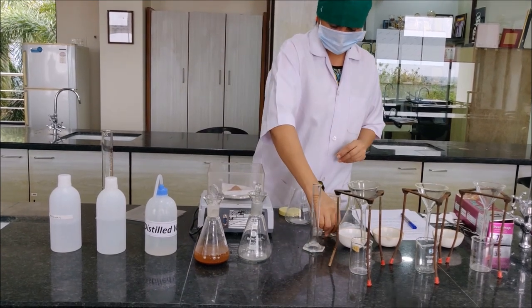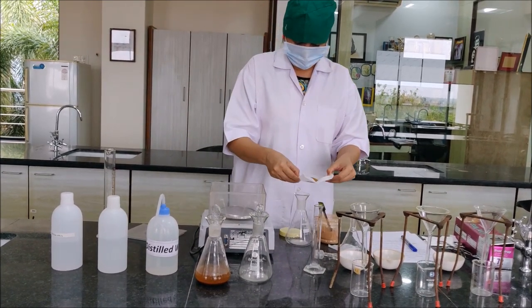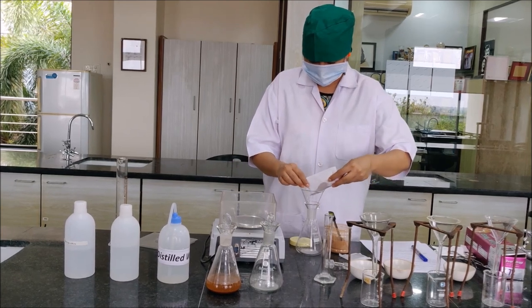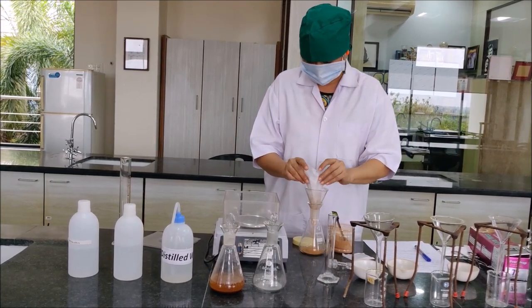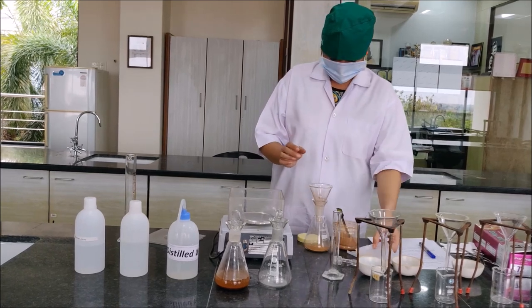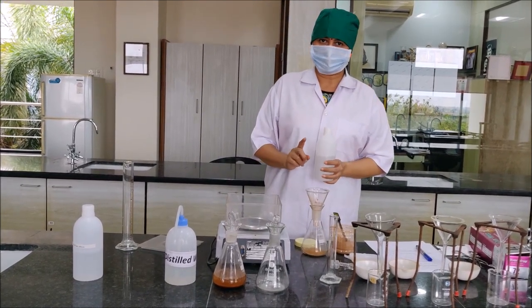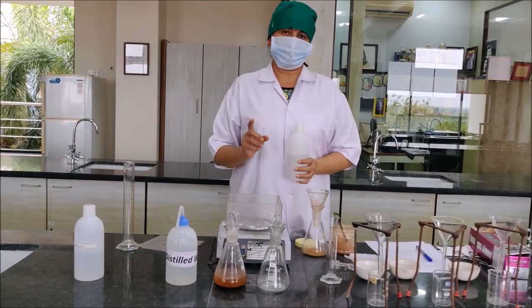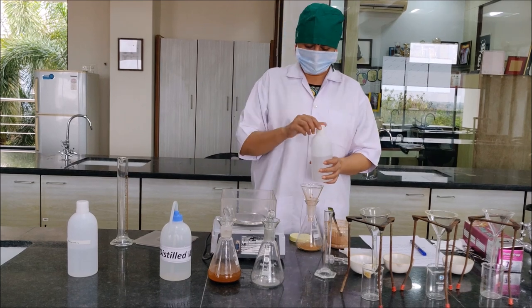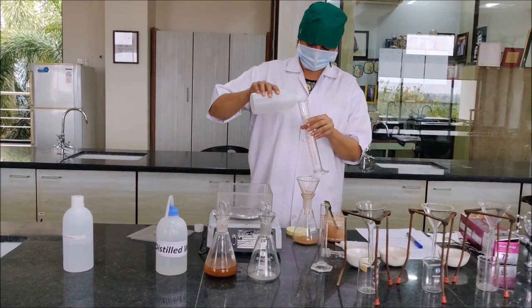The next step is to transfer it into a clean conical flask. So I have transferred it. Now, there are 3 ways of calculating extractive value: using water as a solvent, called water soluble extractive value; using 95% alcohol, called alcohol soluble extractive value; and the third is ether soluble. Right now I will be using 100 ml of 95% alcohol as a solvent.